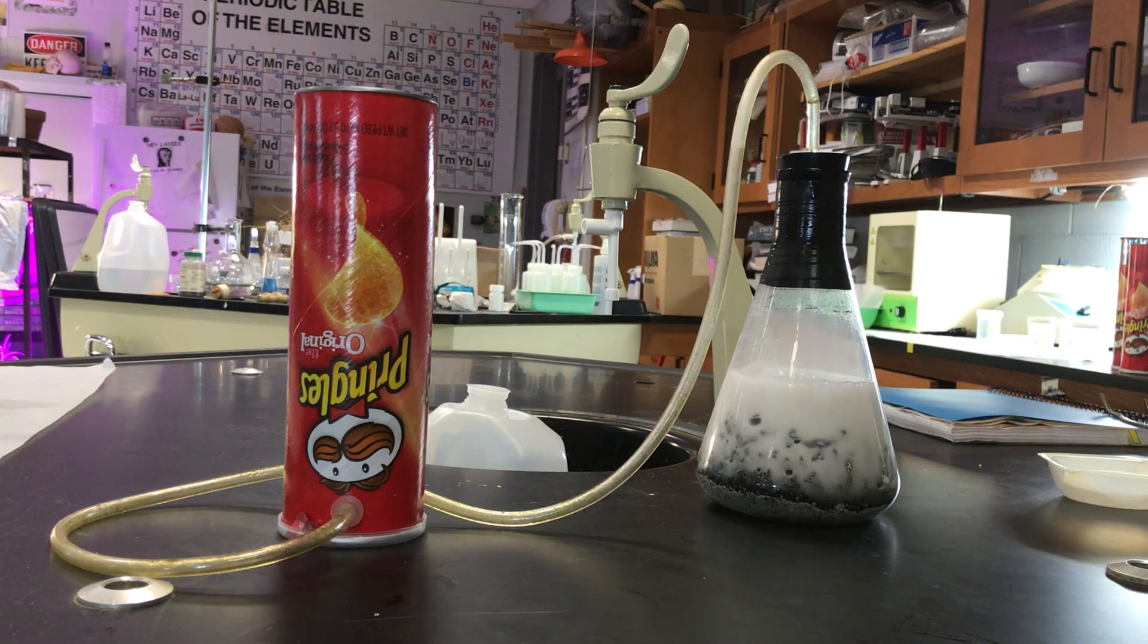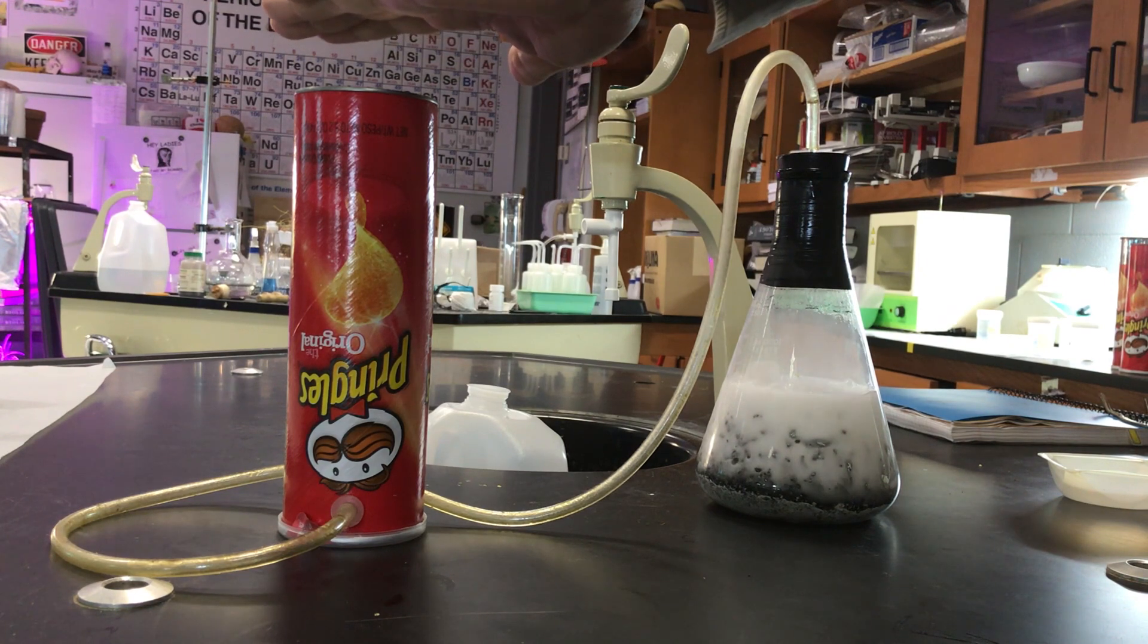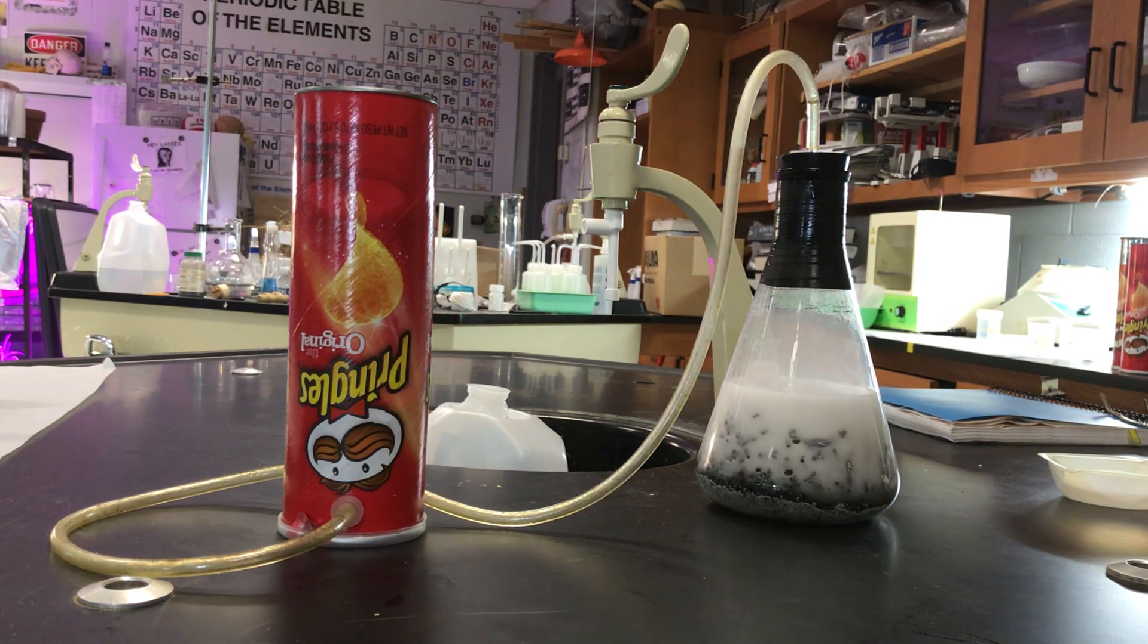of gas here, so I'm thinking we're almost there. Now sometimes I light it and it happens right away because I didn't wait for it to flush, but I can feel I pushed out all the air and it should be full of hydrogen. I don't know how much oxygen is soaked into a Pringles can - I've never done it with a can in there.